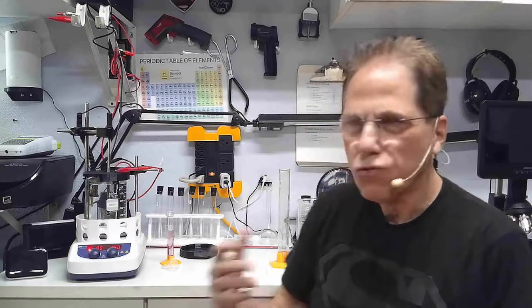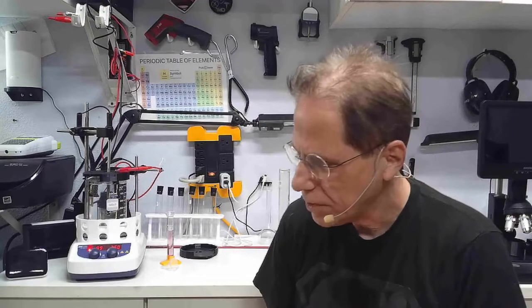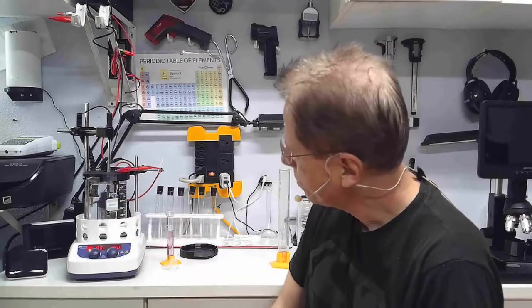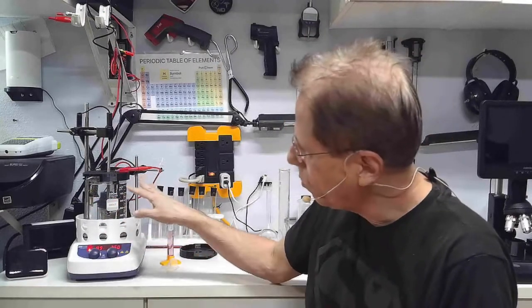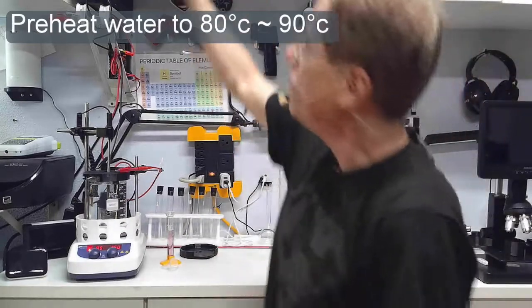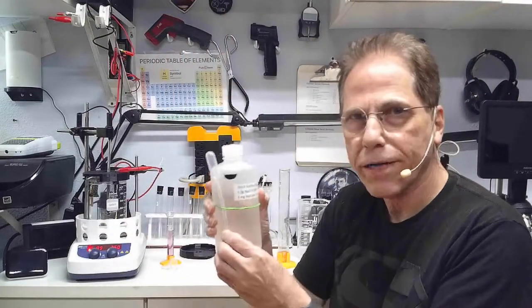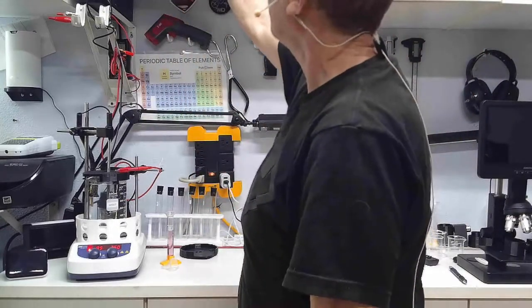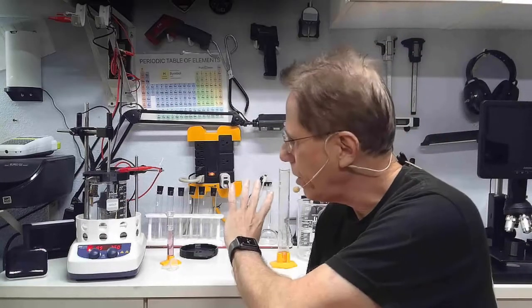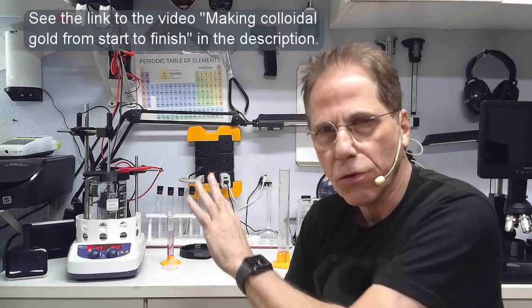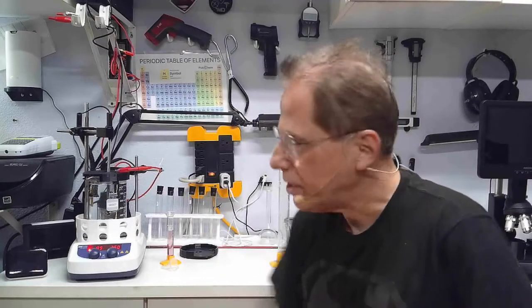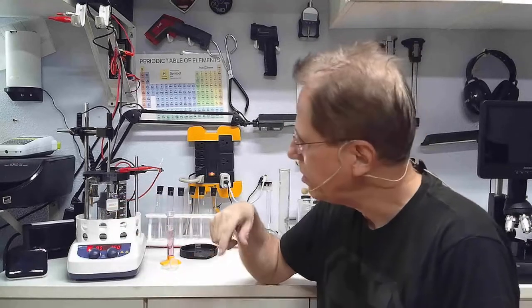I'm getting ready to cook a batch of colloidal gold. What I like to do is preheat the water in the microwave for six minutes. This is 500 milliliters of water. Then I add all of our chemicals, which brings it up to 550 milliliters. Refer back to the how-to-make colloidal gold video for all the little intricacies. I'll put it in the microwave and heat it for six minutes. That gets me to about 80 to 90 degrees Celsius. Then I toss it on my heated stirrer and let it bring it up the rest of the way.